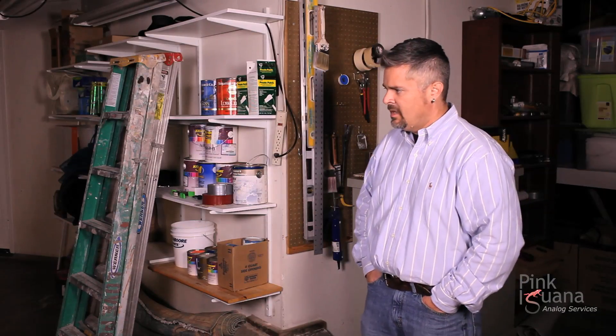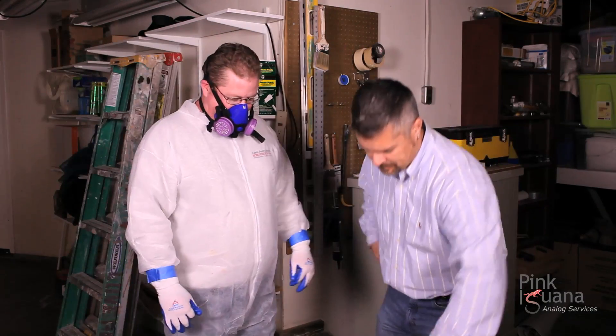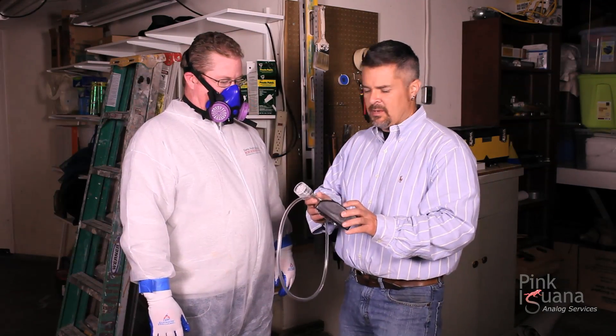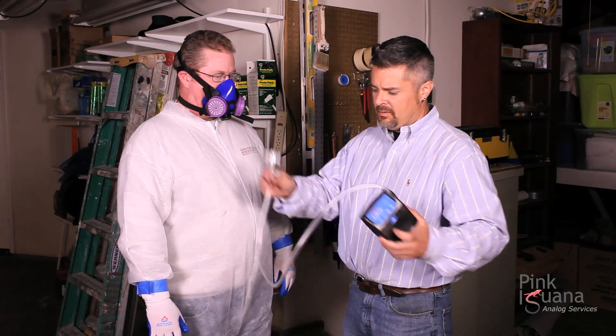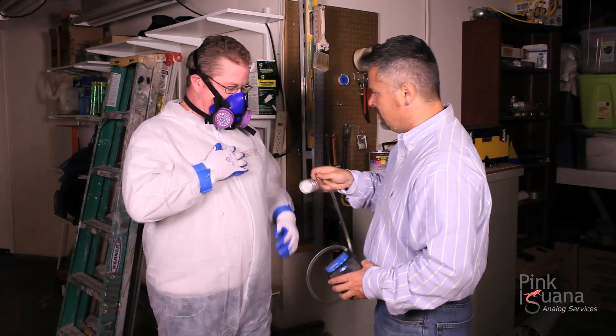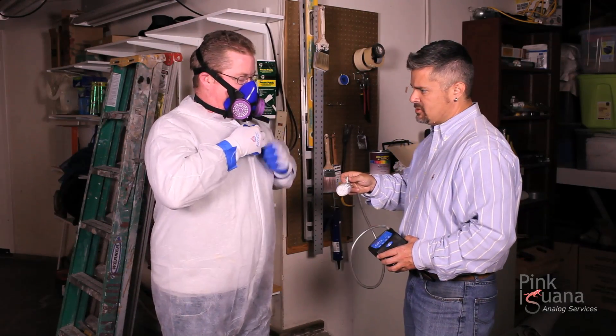What I'm going to show you now is how to take an air quality monitoring pump and filter and apply that to an employee in the field so that a sample can be taken. We're going to invite my employee Joe to join me here, and we're going to have Joe put it on so I can show you how this works. As the previous demonstration pointed out, there's the pump, there's the hose, the filter, and the clip. Joe, why don't you pull the zipper down on this disposable suit.